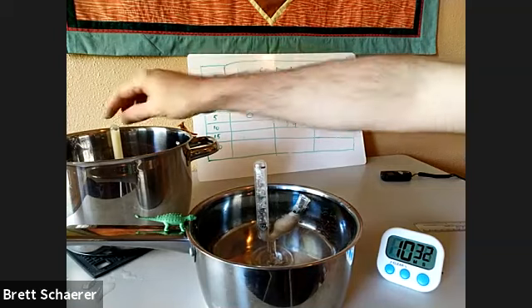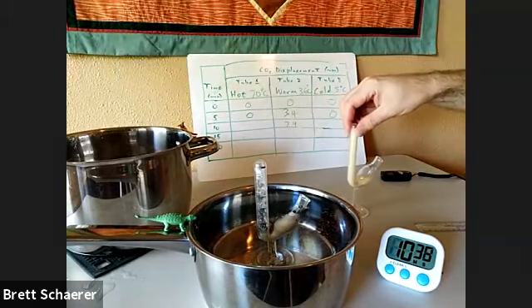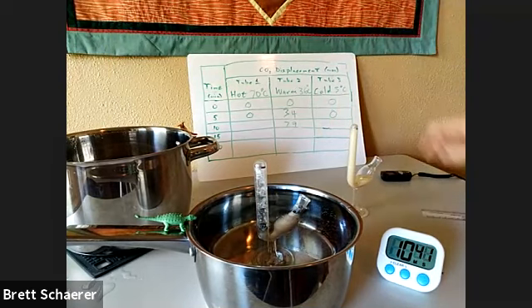And we'll go over to tube 1 in the hot environment. Still at 0.